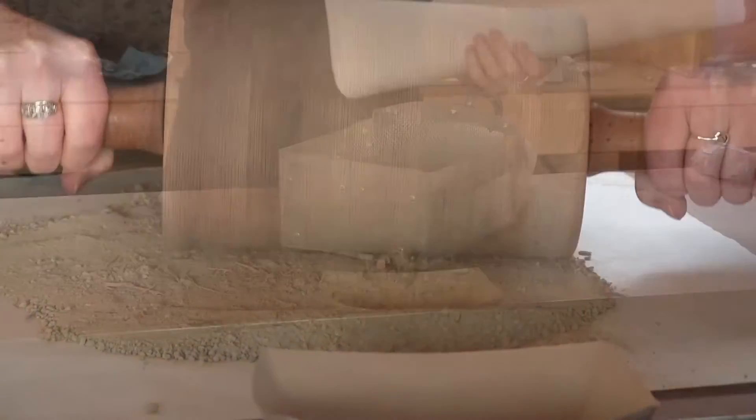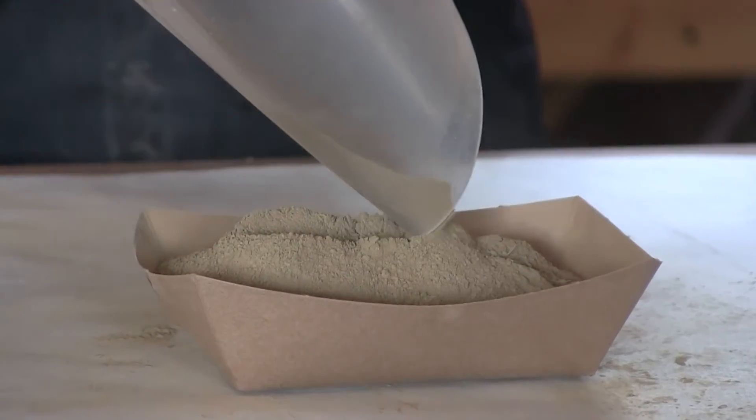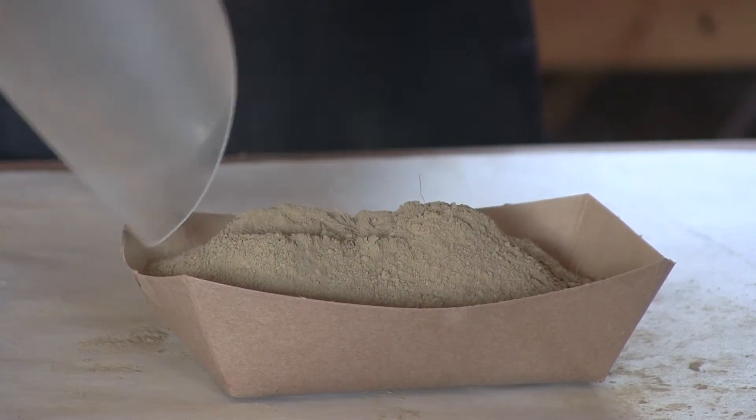When the sample appears appropriately flattened, we shake it through a smaller size sieve. Notice how the intrinsic structure is largely preserved in this sample.